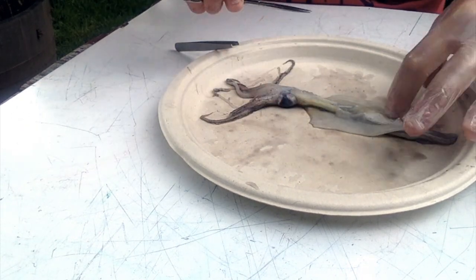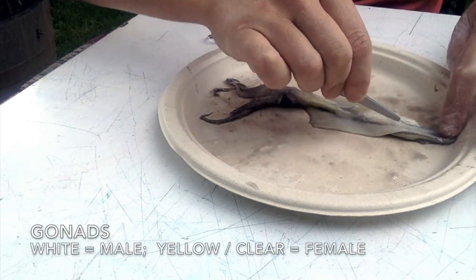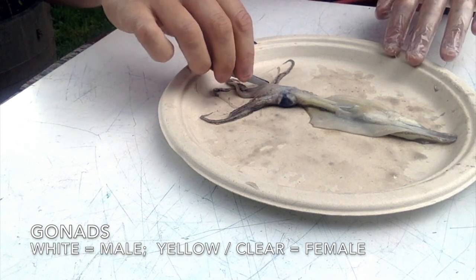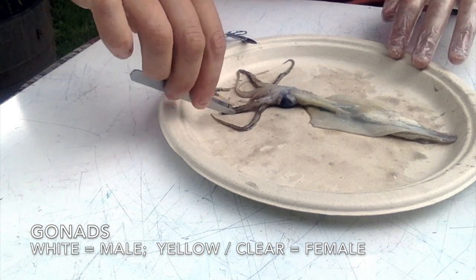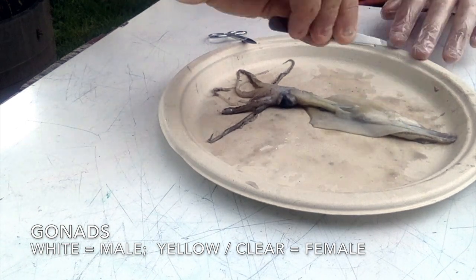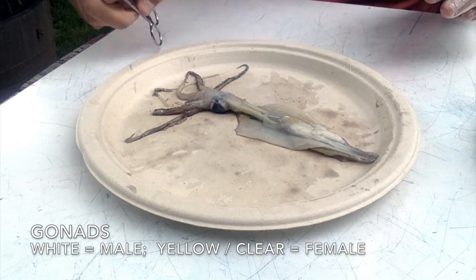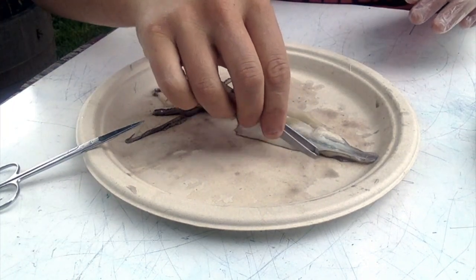And by cutting through, right away, I can recognize that this area at the top is going to be the sperm. And so we know right now that we have a male squid. A female squid would have a much more yellowy structure in here. And that's what would turn into eggs over time, or in the right time.